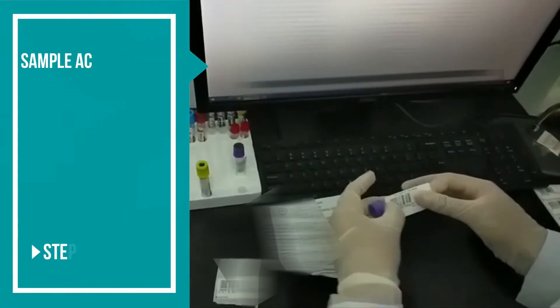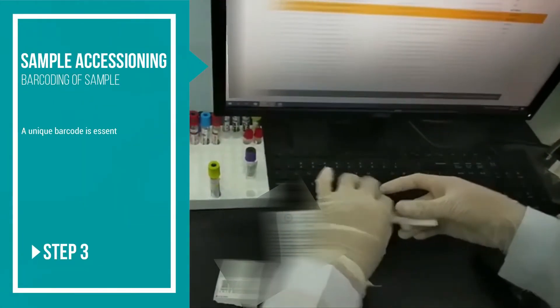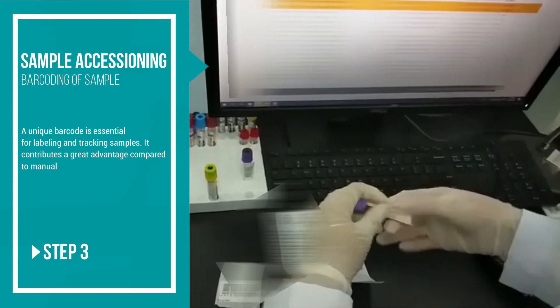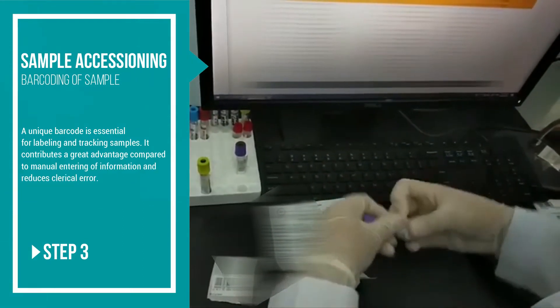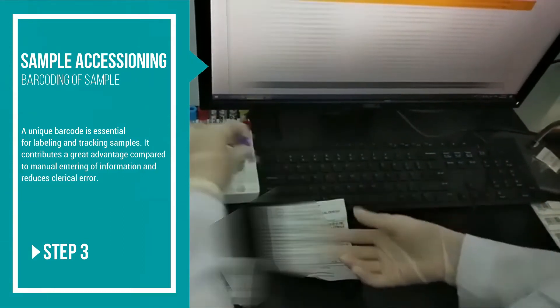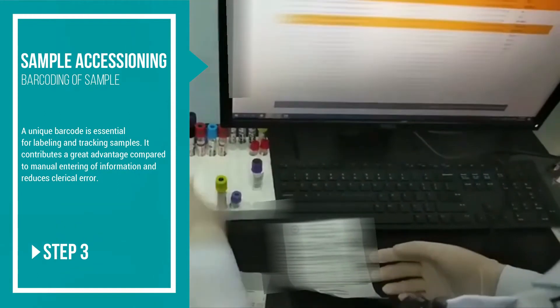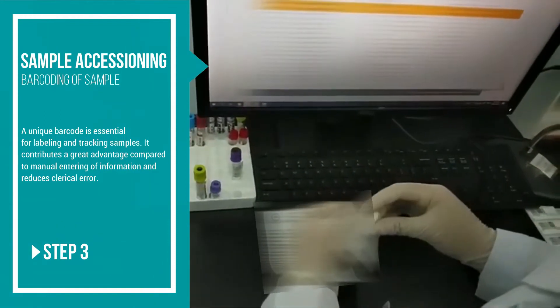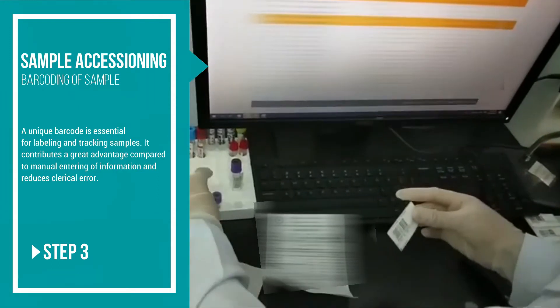A unique barcode assigned to each tube is essential for labeling and tracking of samples. It contributes a great advantage compared to manual entering of information and it also reduces clerical errors.